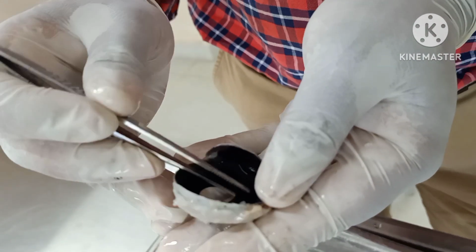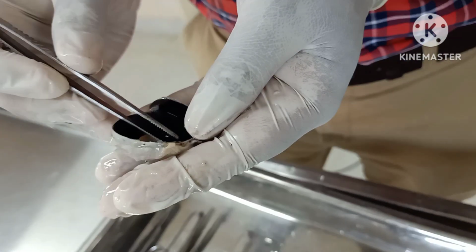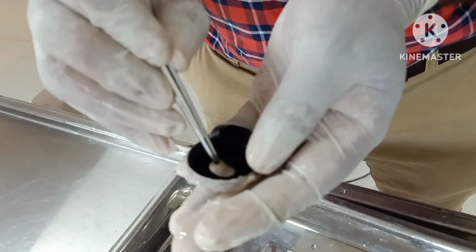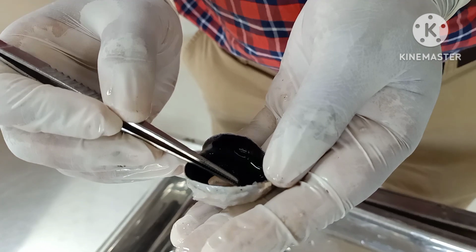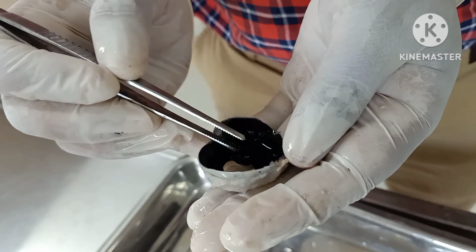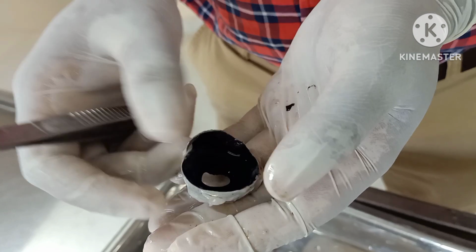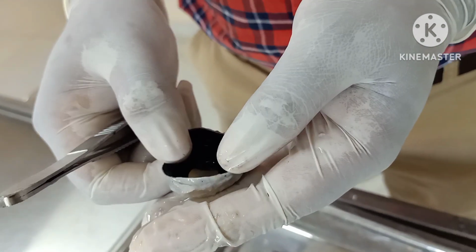The anterior compartment is again divided into two chambers. The anterior chamber is lying between the cornea and the iris, and the posterior chamber is lying between the iris and the lens. Behind the lens, the entire thing is called the posterior compartment. So these are the structures which you see in an eyeball dissection.